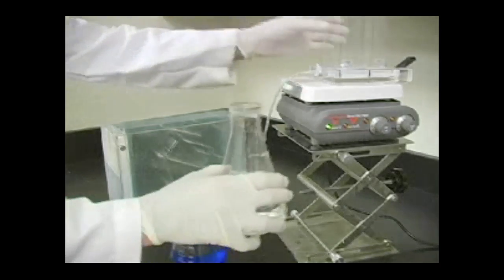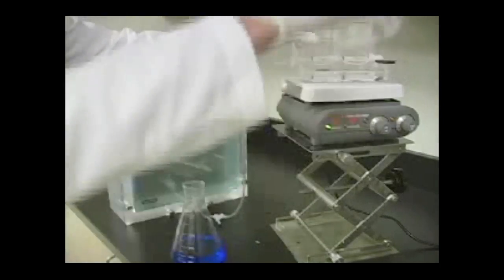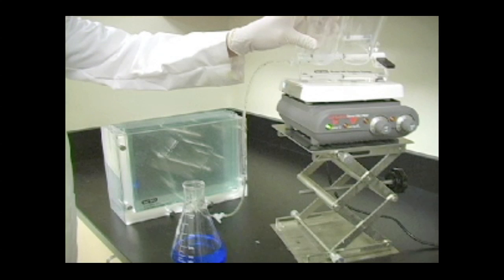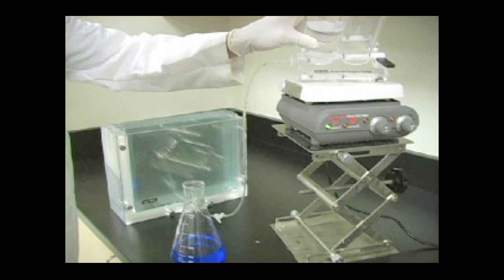Making sure that the valve stem is closed, pour the light solution into the chamber labeled light and the heavy solution into the chamber labeled heavy.